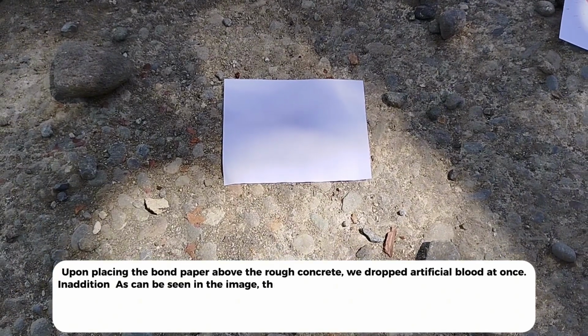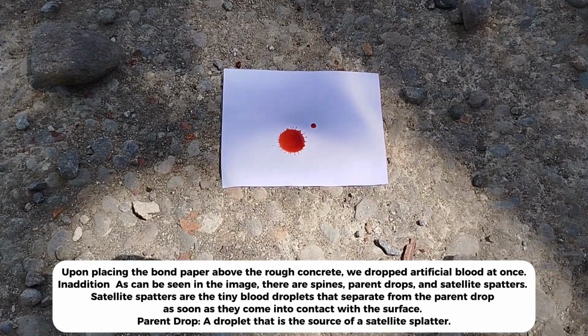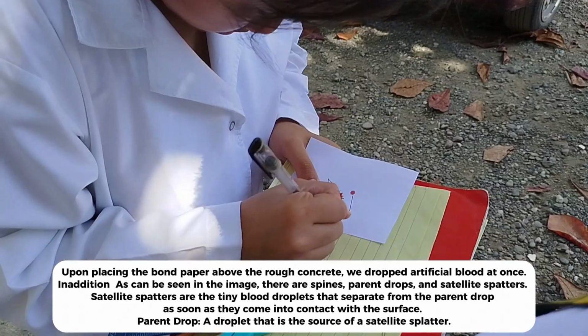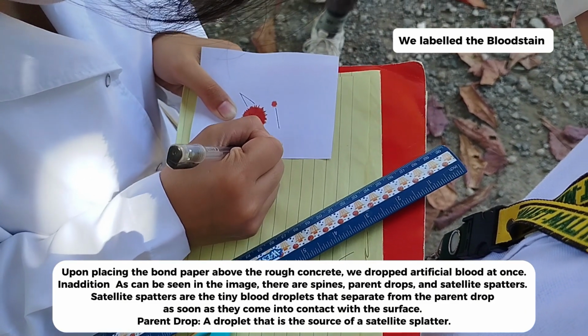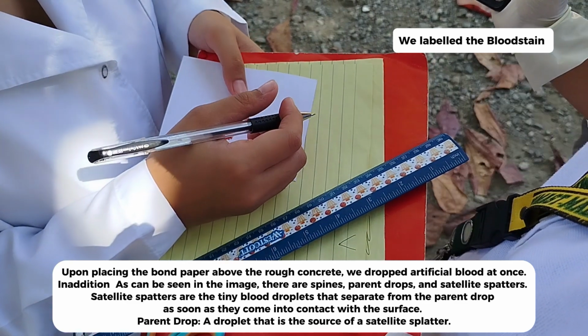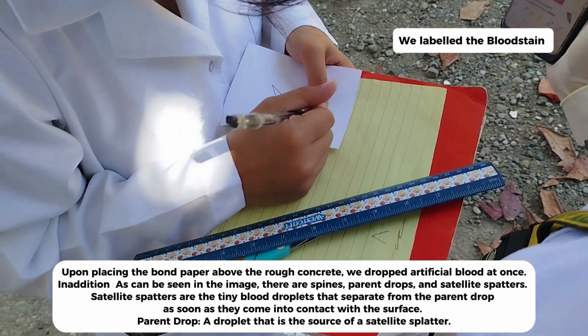Upon placing the bond paper above the rough concrete, we dropped artificial blood at once. In addition, as can be seen in the image, there are spines, parent drops, and satellite spatters. Satellite spatters are the tiny blood droplets that separate from the parent drop as soon as they come into contact with the surface. Parent drop: a droplet that is the source of a satellite splatter.